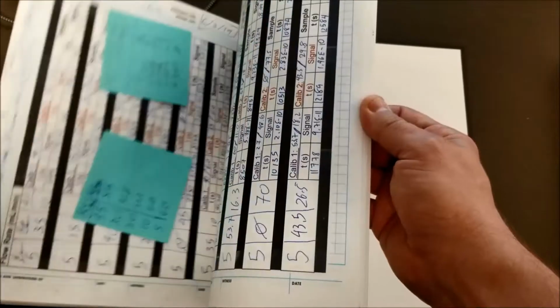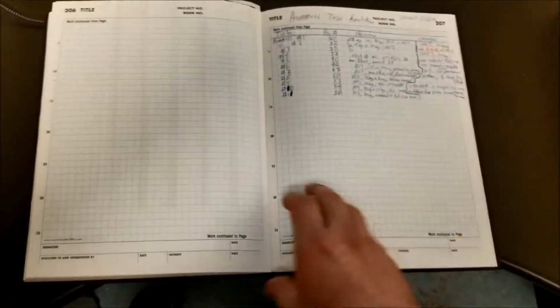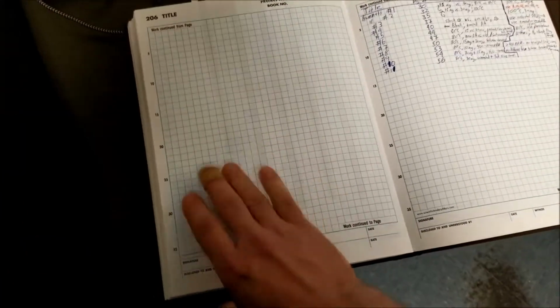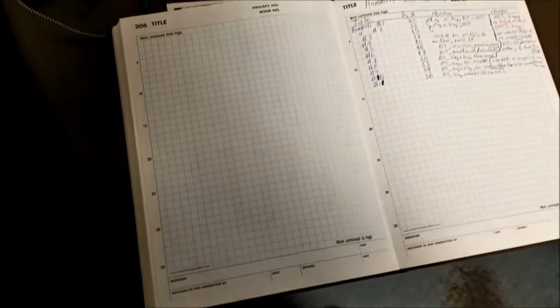But that started with the initial experimentations, figuring out the system, and led into the kinetic section, where instead of writing the same charts over and over again in the book, I finally started printing them. And that goes to almost the end of the notebook. I think there'll be one blank page left. So that is the notebook with my name on it.